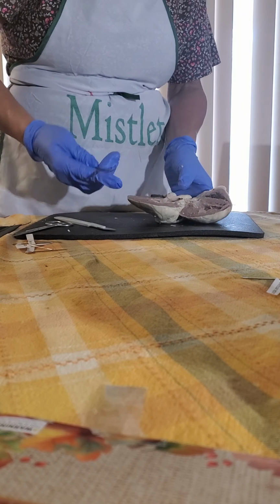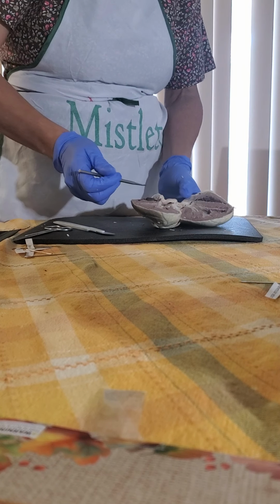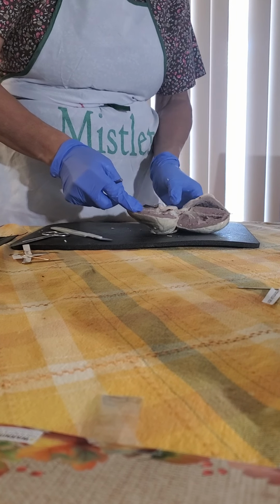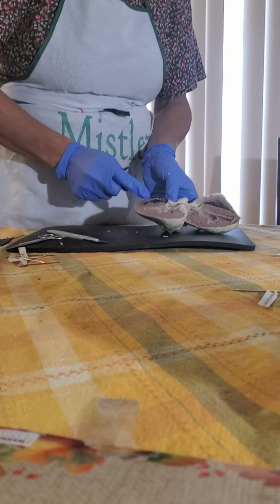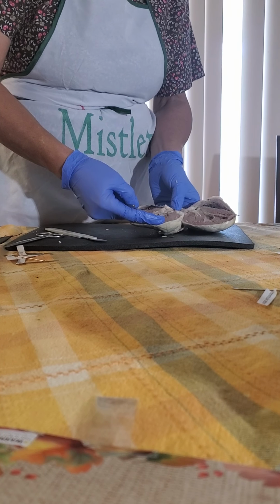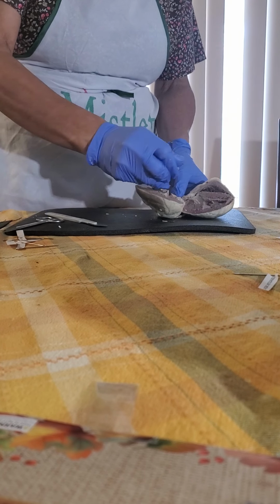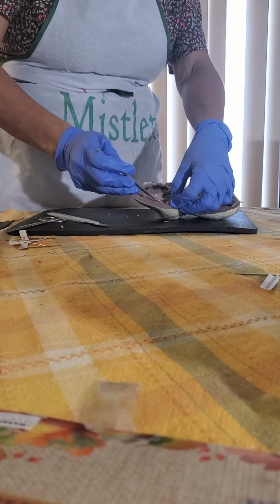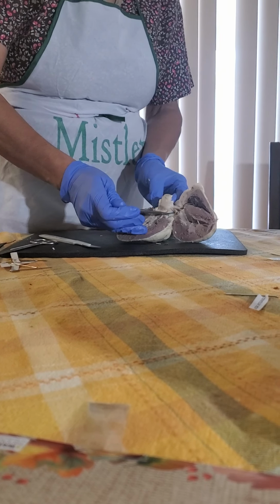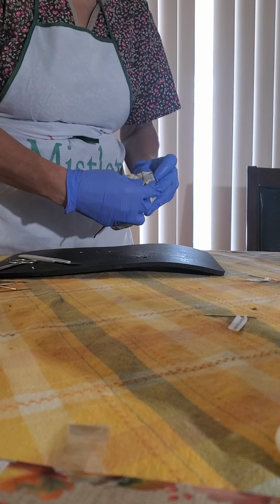Now let's try to see the circulation in the right atrium. Blood flows in by the vena cava, then passes from the atrium through the tricuspid valve. So you can see, and then it flows down to the right ventricle. From the right ventricle, which you can see on the side of the heart, it will go up to the pulmonary artery, which is one of the most anterior blood vessels, as I showed you on the surface of the heart.